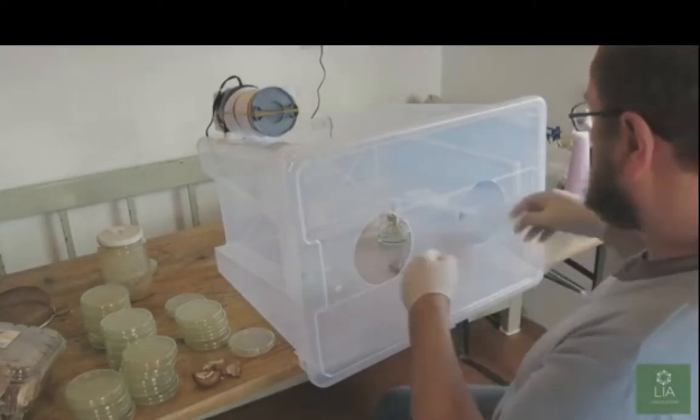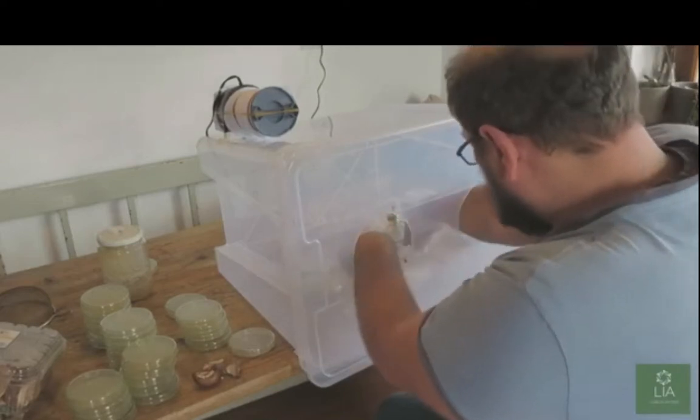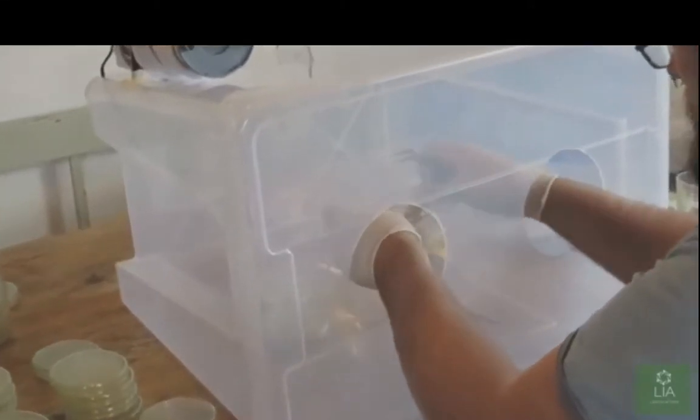Alcohol just spraying everywhere. Oh, heavens to bitsies. He didn't sterilize the tweezers. Well, theoretically, the mycelium he's got is not sterile anyway, but you don't want to add more stuff to it. Oh, he's just putting it right in the dish.